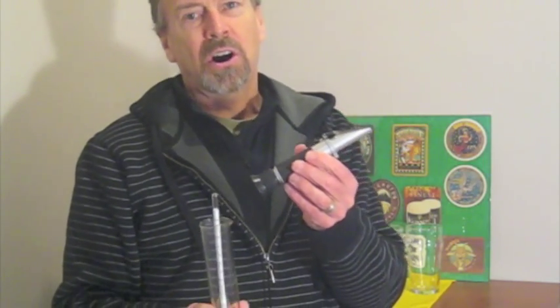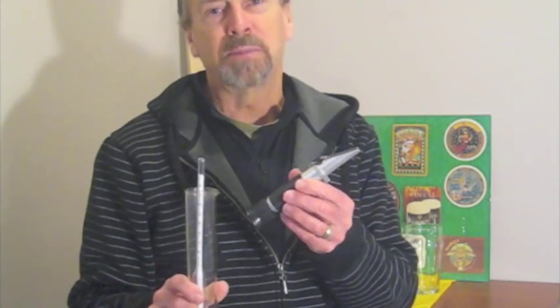Now what we're going to focus on is the accuracy and consistency of the refractometer. The advantages here are it's quick, it's simple, it uses a very small sample size, and it has what's described as automatic temperature compensation.